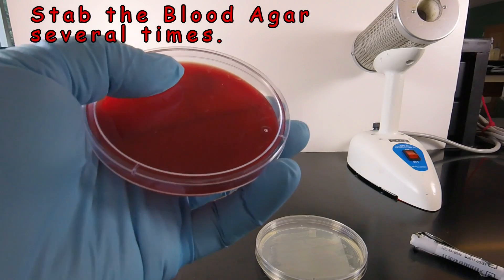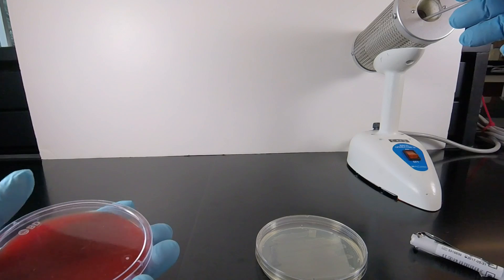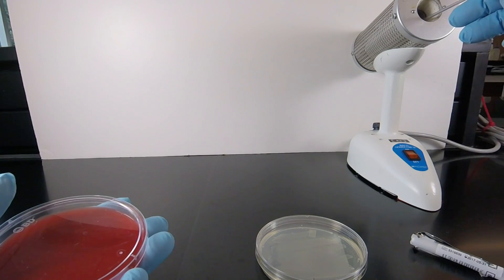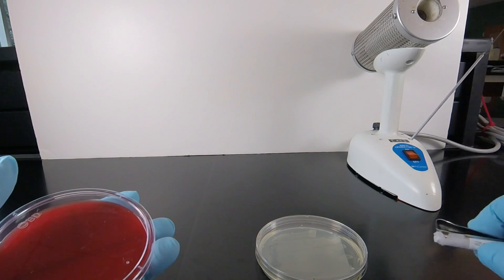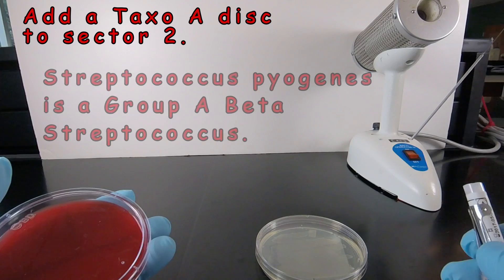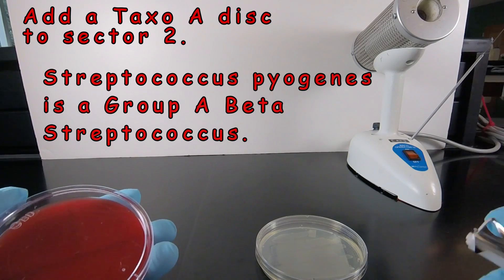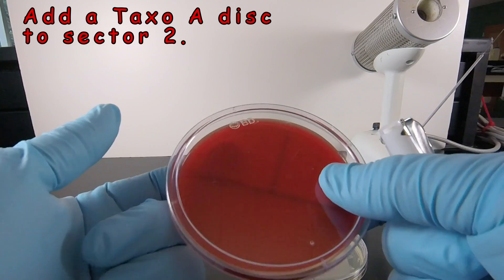Now that we've streaked the plate for inoculation, we sterilize the inoculating loop. We're now ready to place on the Taxo A or bacitracin disc. It's called an A disc because it's used to identify Group A beta strep, which is Streptococcus pyogenes. We're going to place the Taxo A disc in the center of Sector 2.